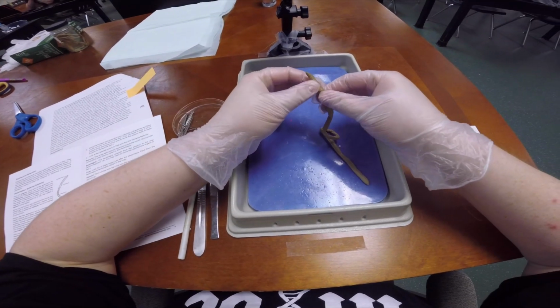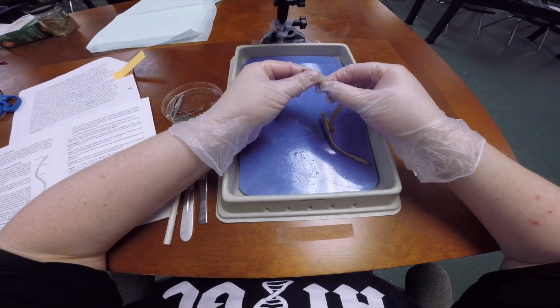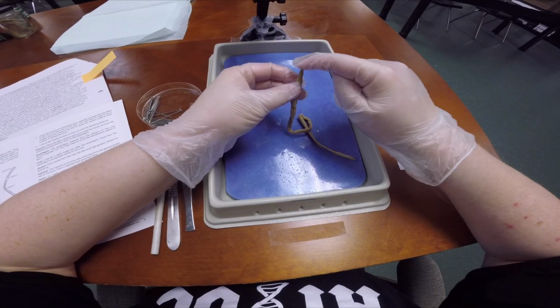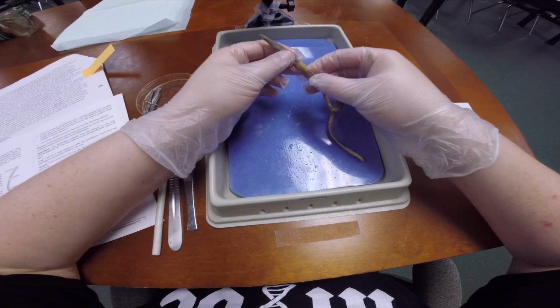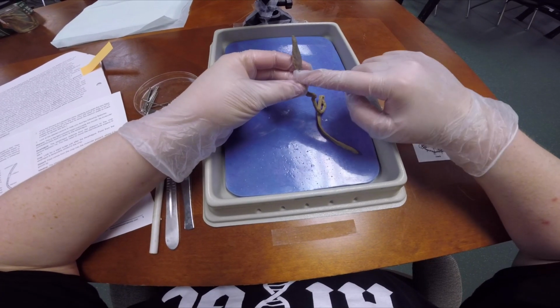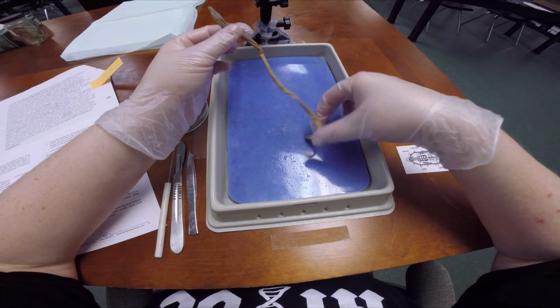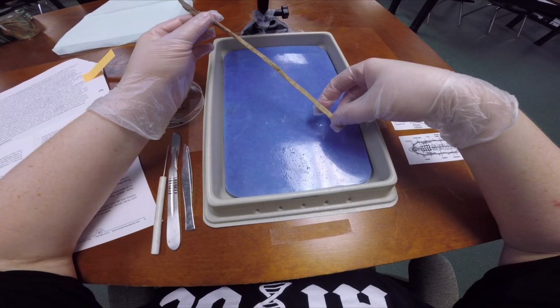at the bottom side. We're going to look at a few things on that part first. You're going to locate the mouth, or the prostomium, which is at the very top. An easy way for me to do this is I find the segment here, and then this big segment right here is what you're going to look at, and then find the shortest way to the top. That's going to be your mouth, or your prostomium, and then the longer piece right here is going down to the posterior, or the anus.